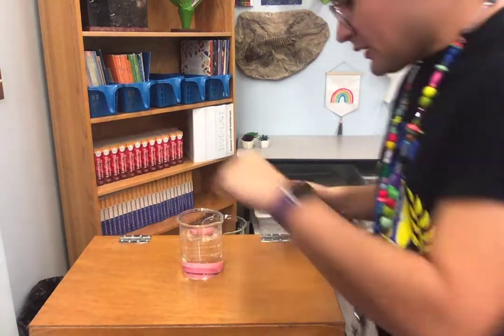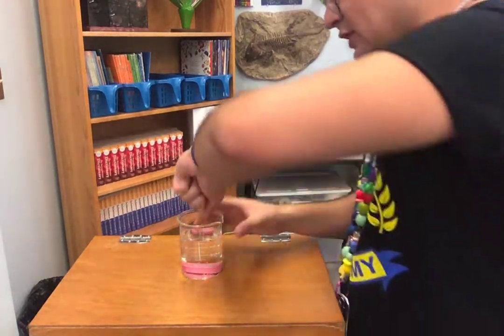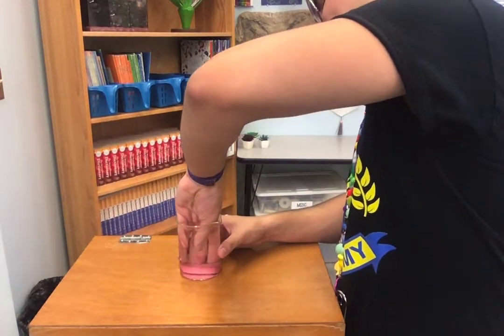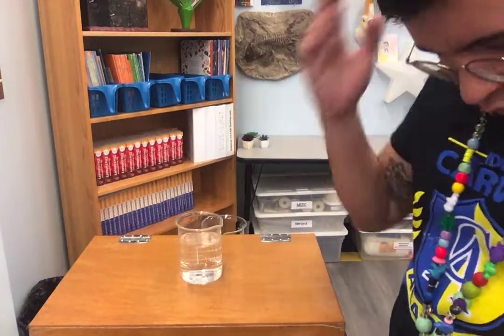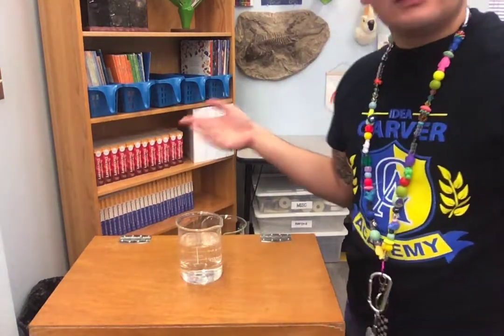All right. I'm going to leave that in there. Actually, no, let's take it out. Oh, my hand's too big. Oh no, don't spill. Okay. Guys, I didn't spill. Oh, phew. I didn't want to make a mess again.